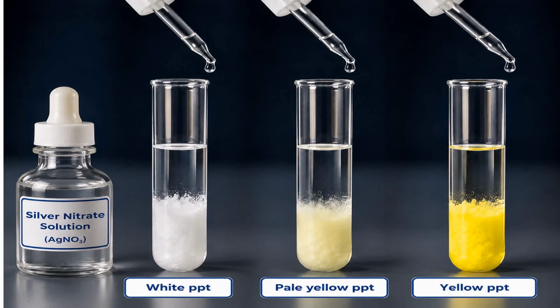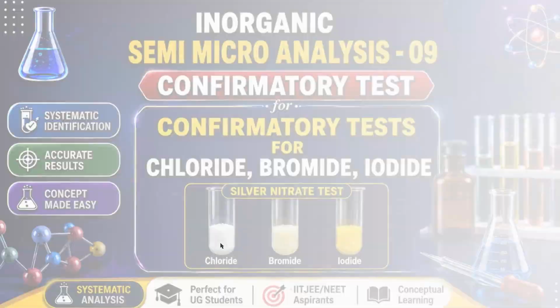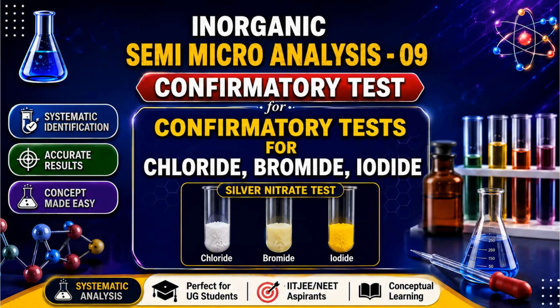Hello, my dear students. Can you tell me, among these three test tubes, which test tube contains chloride ion, which contains bromide ion, and which contains iodide ion? So, let's see these things in this video. Therefore, the topic of this video is confirmatory test for chloride, bromide, and iodide.